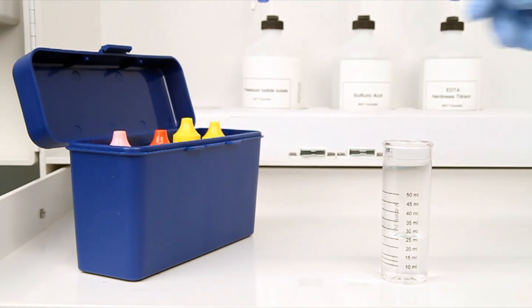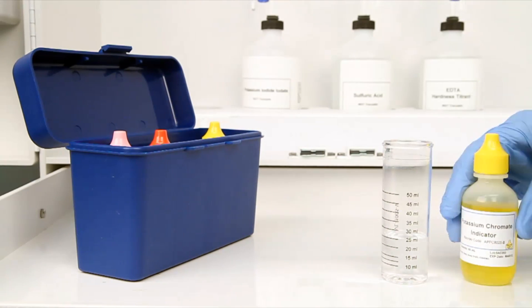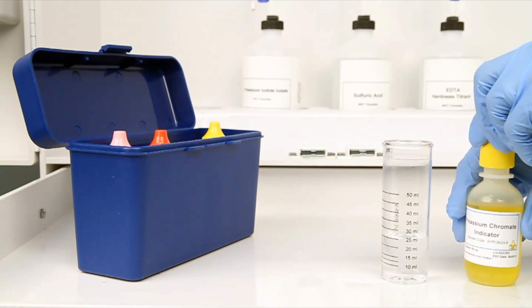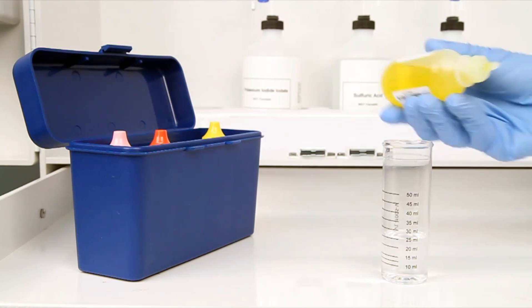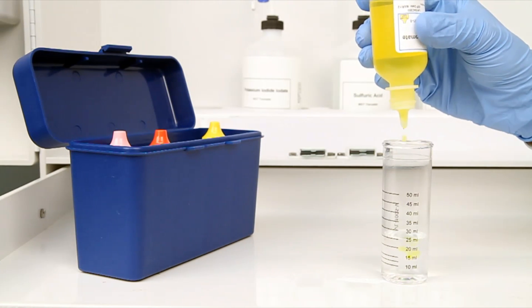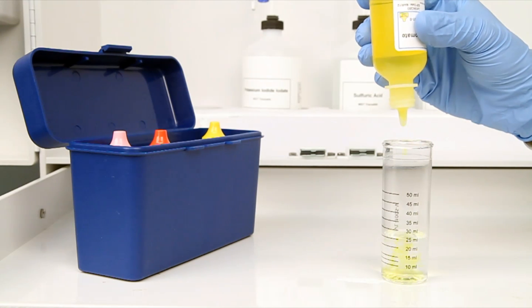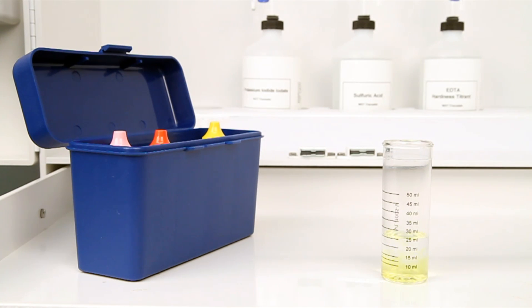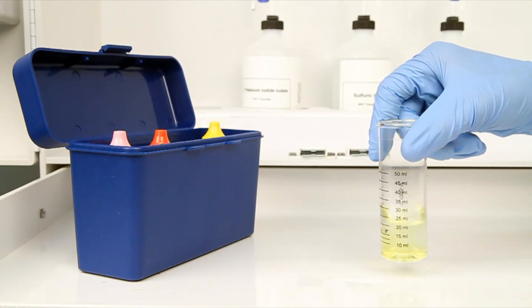The next step according to the Endpoint ID procedure is to add six drops of potassium chromate indicator. The bottle contains a dropper tip, so it is important to hold the bottle vertically to get a consistent drop size. After the addition of each reagent, it is important to swirl the vial to make sure the reagents are properly mixed.